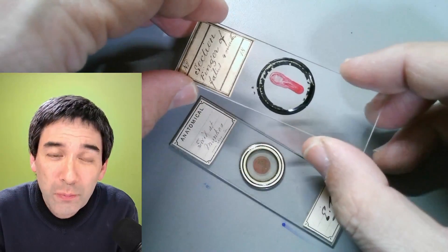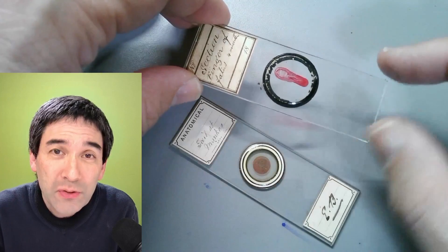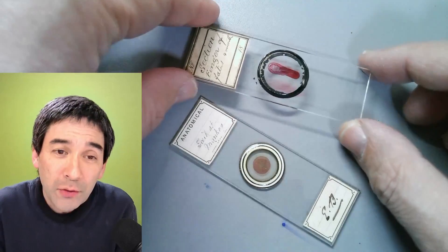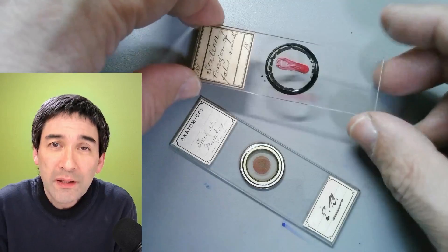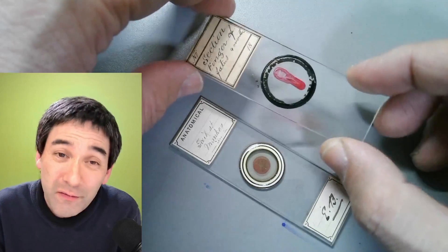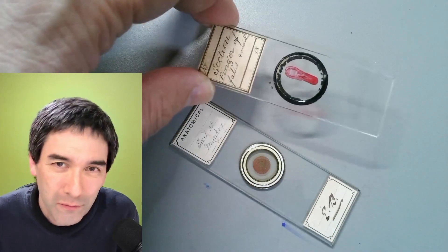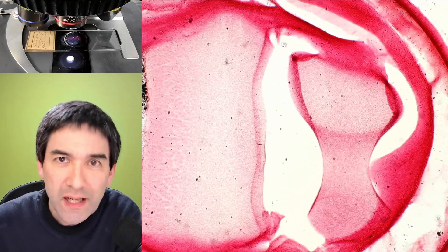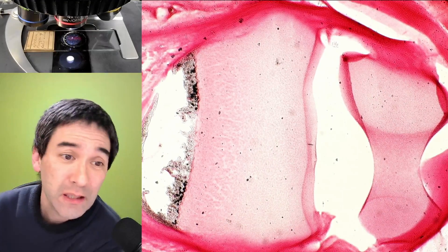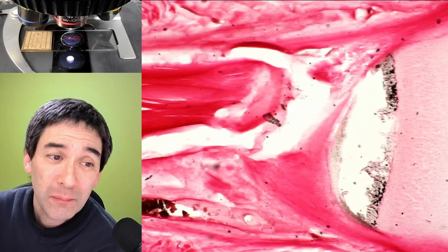It's also interesting under the microscope — not quite as interesting as the tail of a monkey — but you're able to see all relevant parts. I'm not going to go into very much detail when I put them under the microscope; I would like to refer you to one of my previous videos, but we're going to look at it in any case. So I'm switching over to the microscope view now. At low magnification using the four times objective, that's the fingernail there.